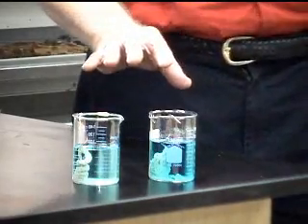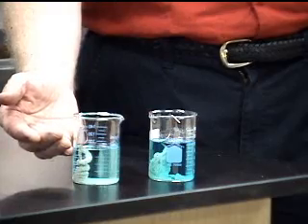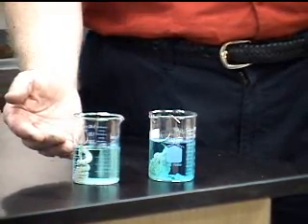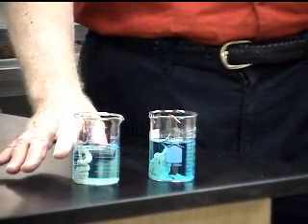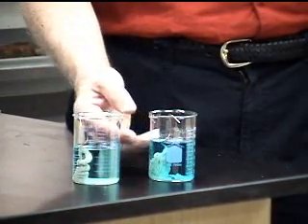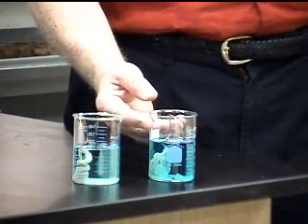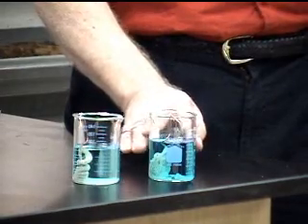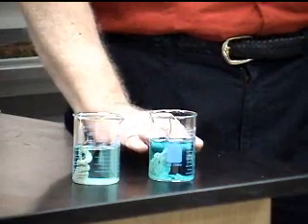So what happened? Well, as the silver ions are pulled out of the solution, it's created a shift in the equilibrium such that it's now deficient in silver ions. To replace the silver ions, the solid silver acetate began to dissolve, even though technically no more was supposed to dissolve. So according to Le Chatelier's principle, if the silver is removed, more silver acetate will dissolve into the solution.